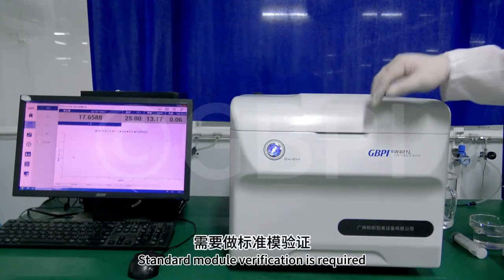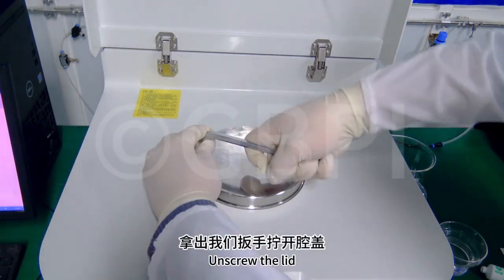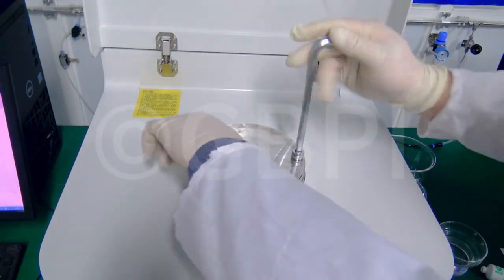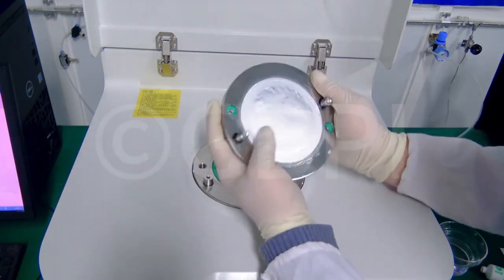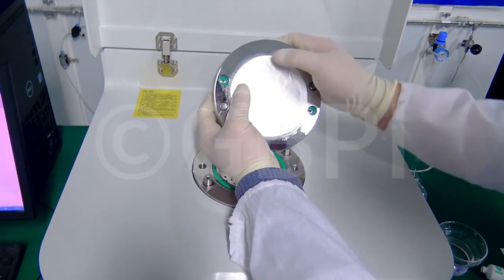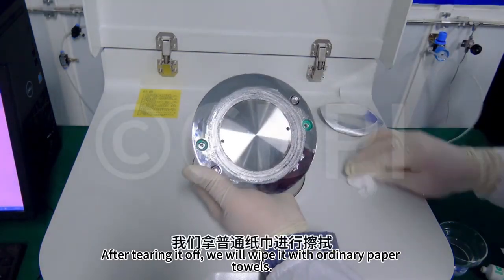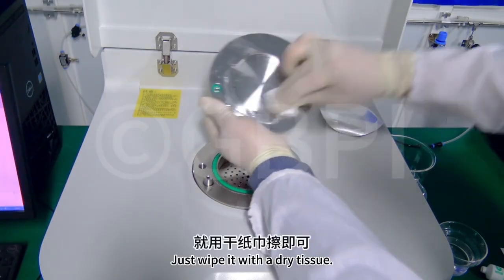After we fill in the baseline, standard module verification is required. Open the protective cover. Take out our wrench, unscrew the lid, and then when we sample, because it is airtight and fits well, we can press lightly like this. After a corner is up, we can tear it off. After tearing it off, we will wipe it with ordinary paper towels. Be careful not to wipe with water. Just wipe it with a dry tissue.